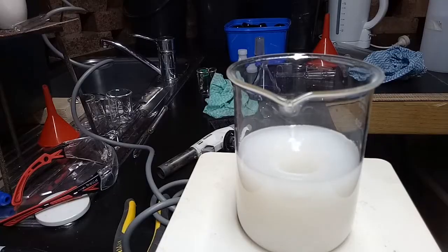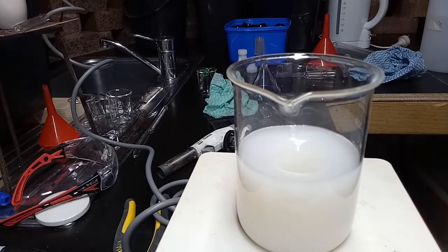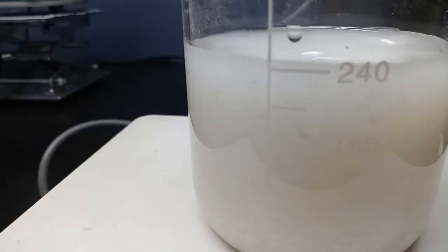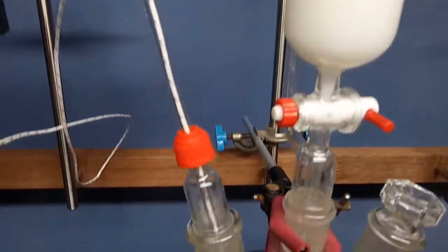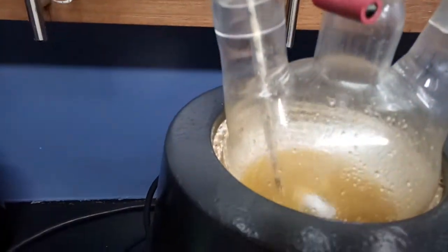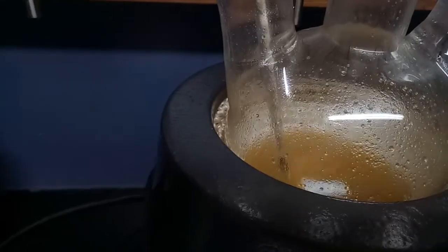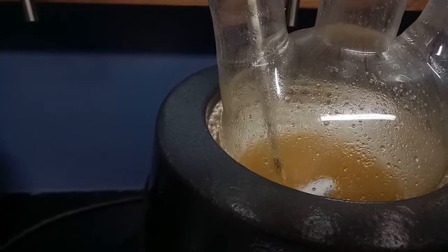The procedure called for the persulfate to be dissolved in a mixture of methanol and water. It did not specify how much of each. I just chose a 50-50 mix. But you can see that our addition funnel is filled with something that's not fully dissolved - it's a bit of a slurry or a sediment.